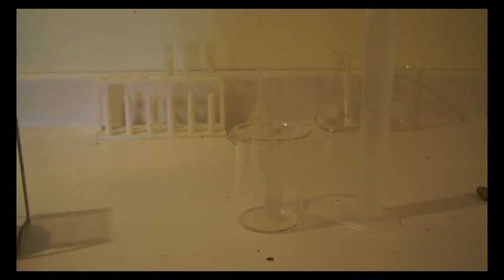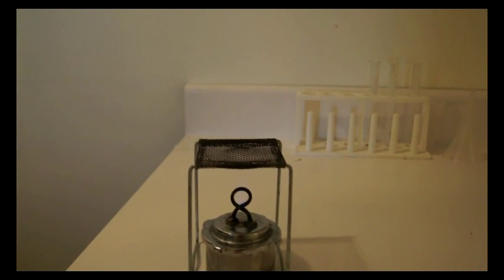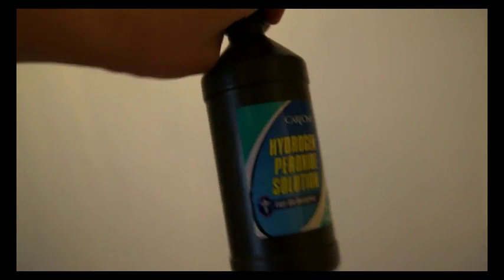Hey guys, it's David here, and today in this video I'm going to be showing you how to concentrate hydrogen peroxide into a 35% or above solution. So what you're going to need is some 3% hydrogen peroxide - you can just get it at a grocery store or a medical supply store.